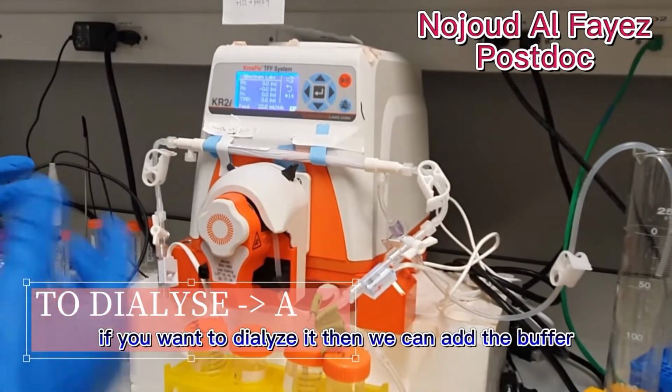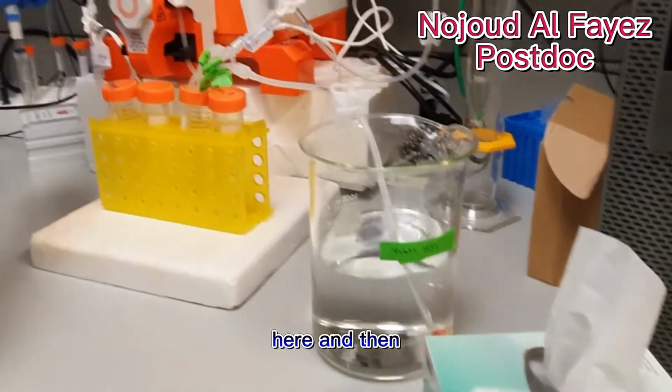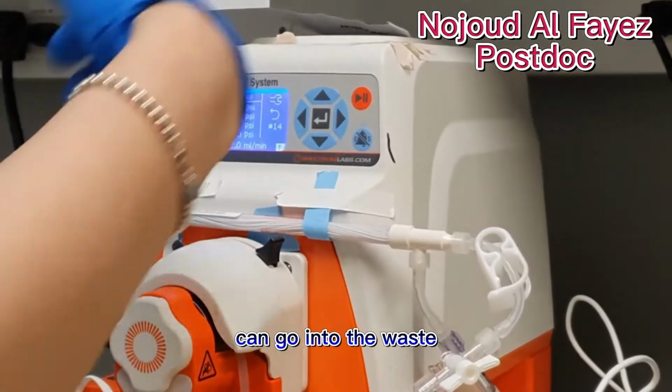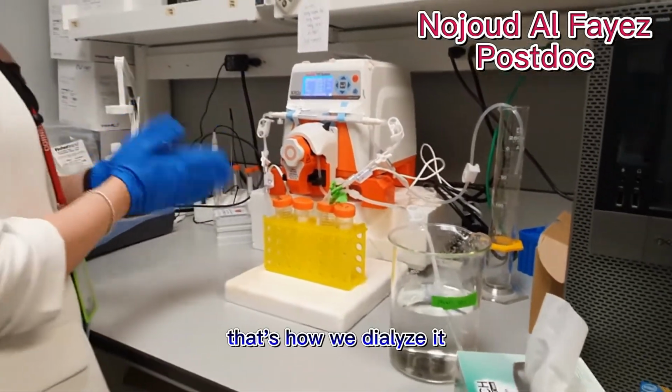If you want to dialyze it, then we can add a buffer here, and then it can run in. The used buffer can go into the waste. The new buffer will keep running. That's how we dialyze it.